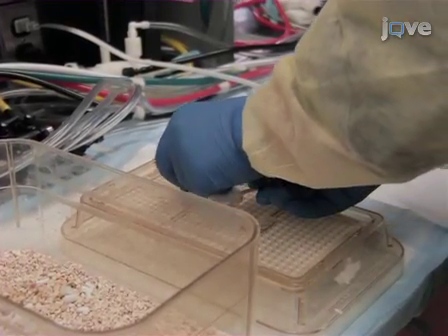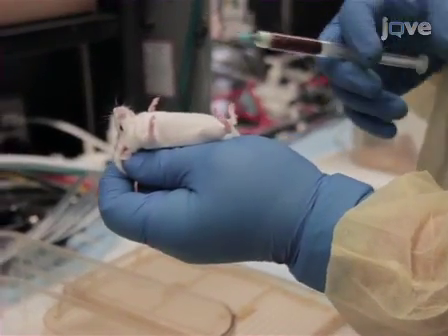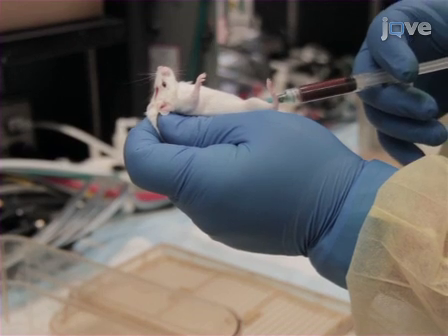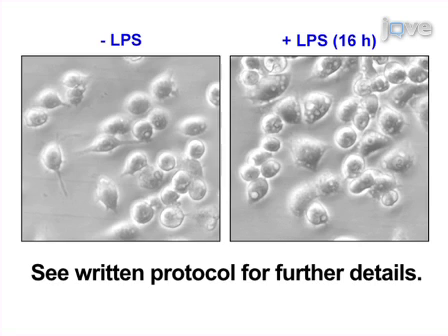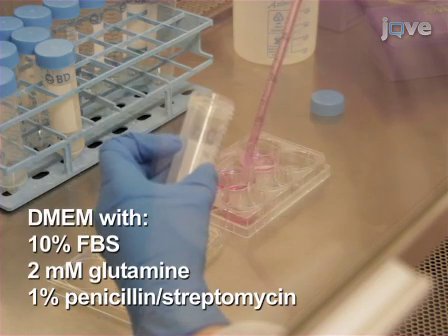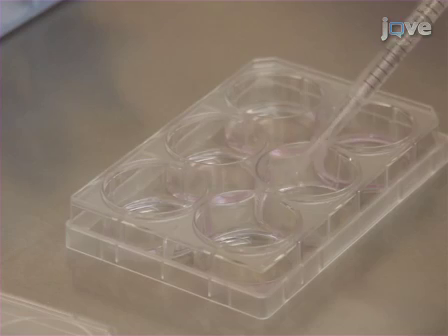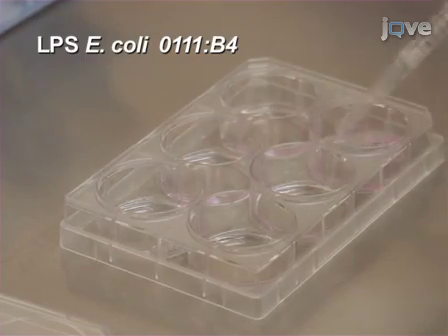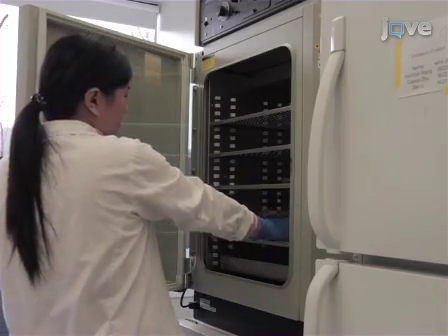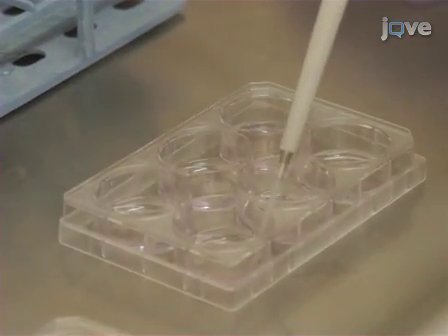To begin macrophage isolation, first intraperitoneally administer 2 milliliters of a 4% thioglycolate broth into normal mice. After 3 days, harvest primary peritoneal macrophages. Culture the macrophages in DMEM supplemented with 10% FBS, 2 millimolar glutamine, and 1% penicillin streptomycin. Gently wash the adherent macrophages with Optimem and incubate them in the same medium for 2 hours. Then, stimulate them with the bacterial endotoxin lipopolysaccharide, or LPS.